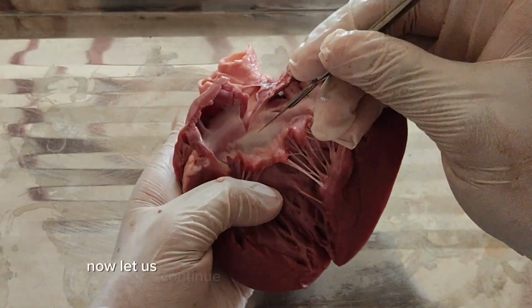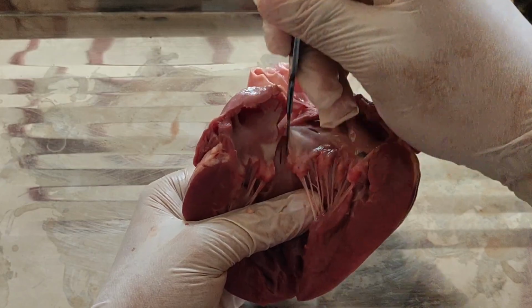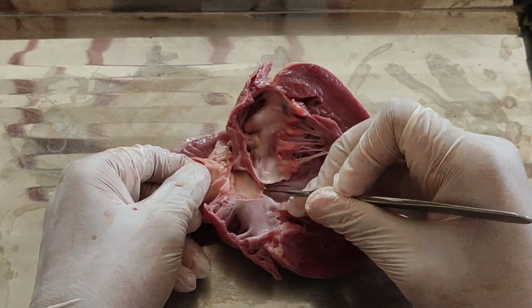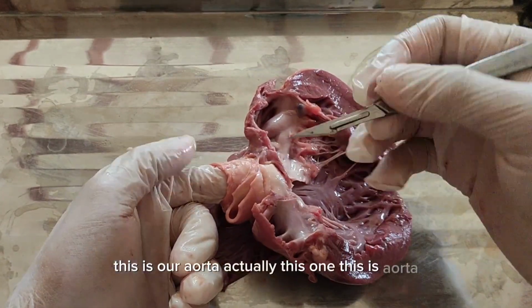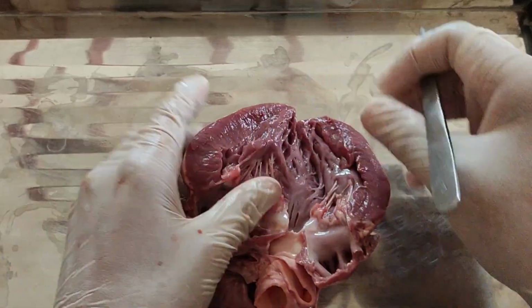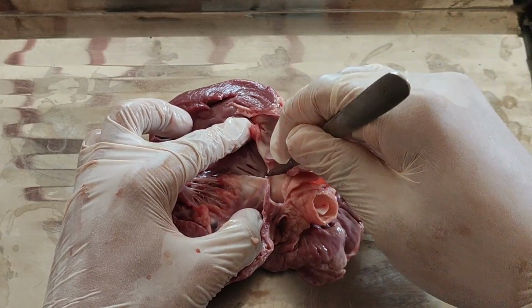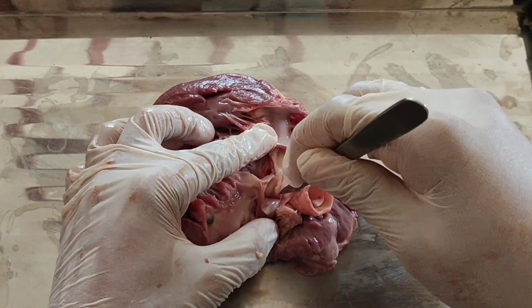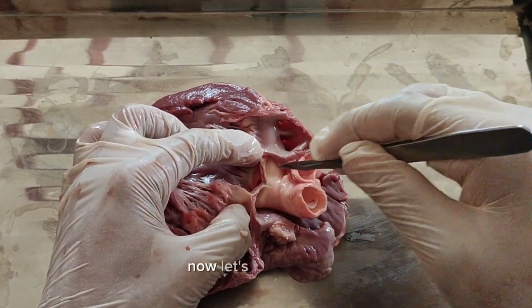Now let us continue cutting to expose the valve here. Okay. This is our aorta actually. This is the aorta. Now let us cut it open. Gently, everyone. Now let's cut through it.